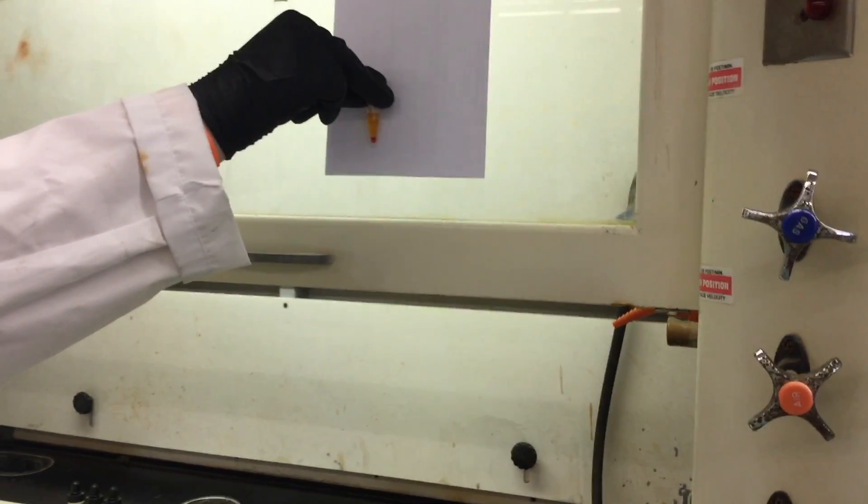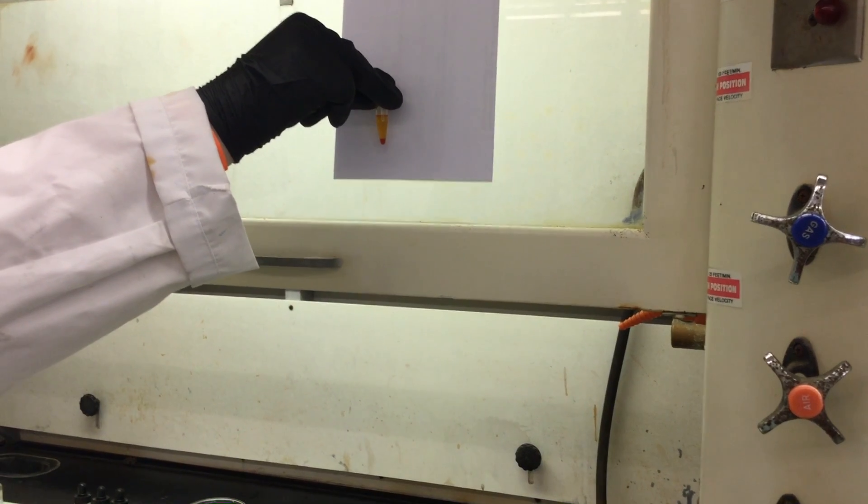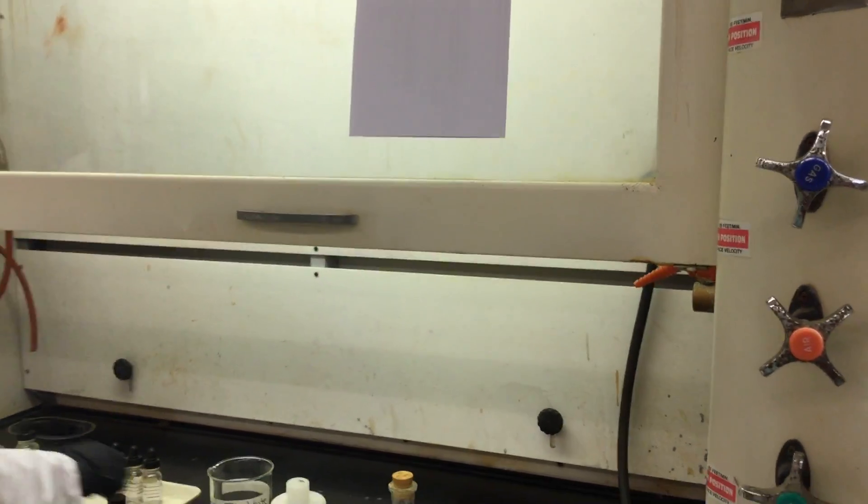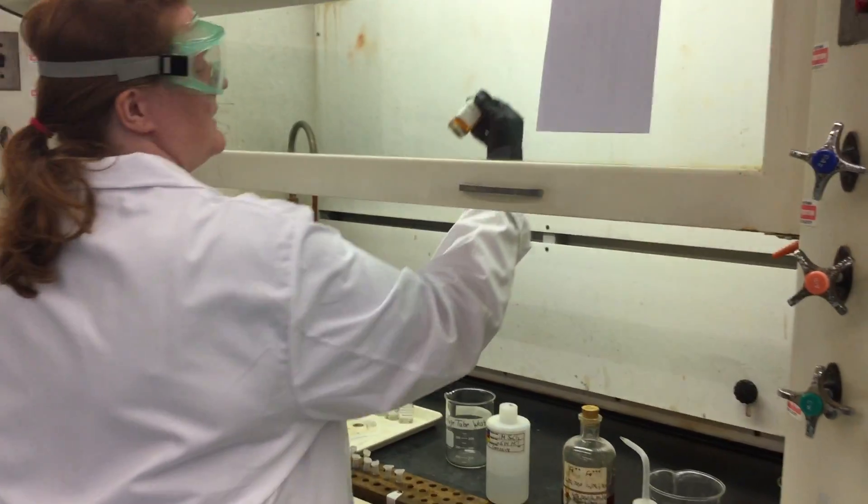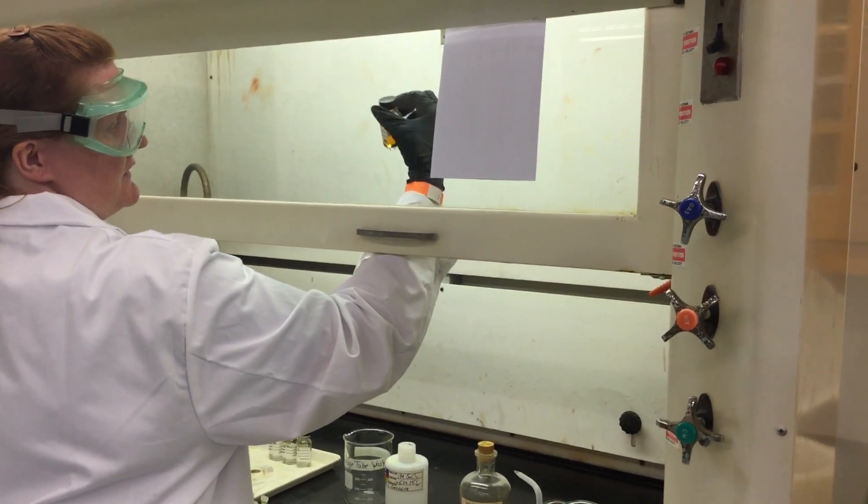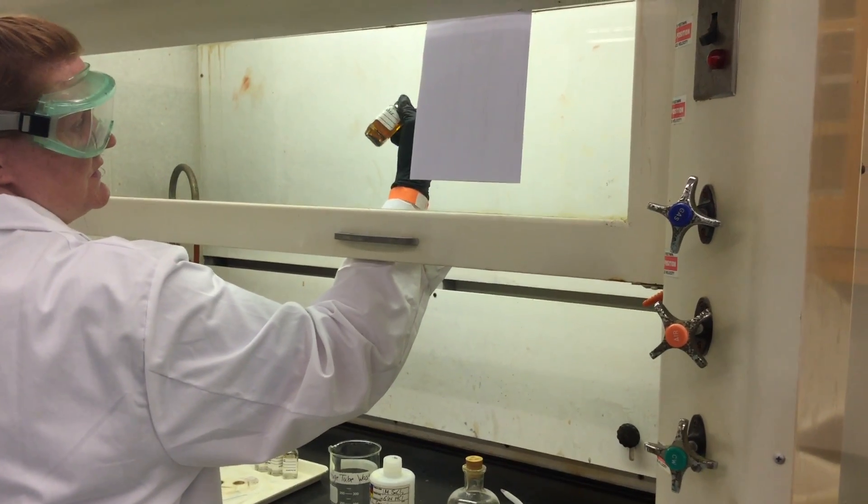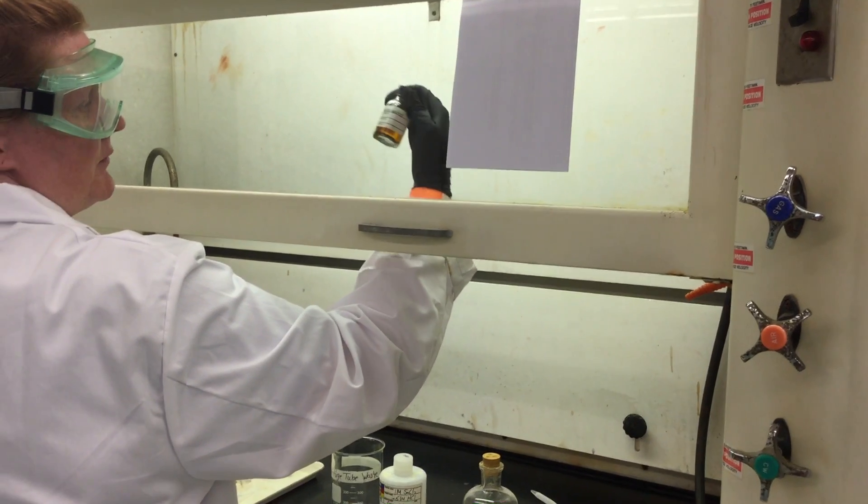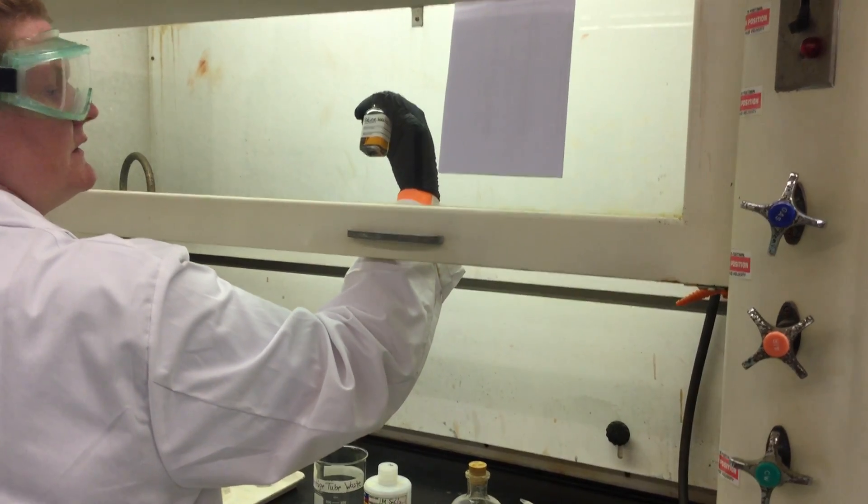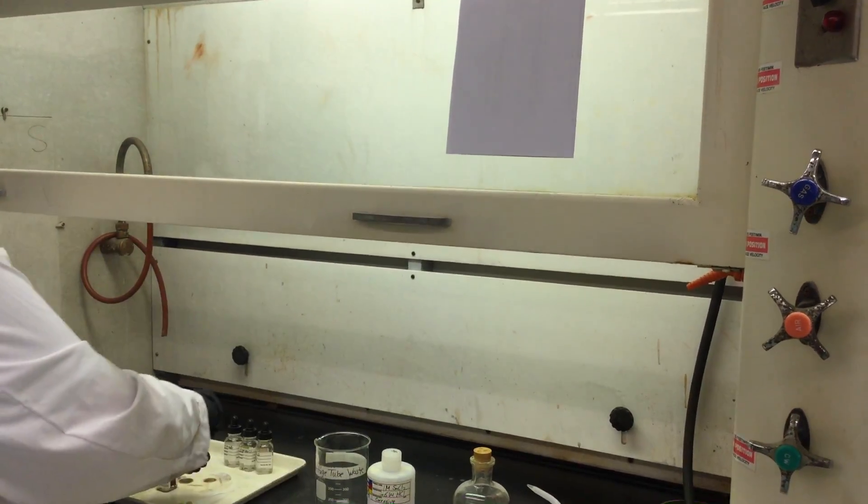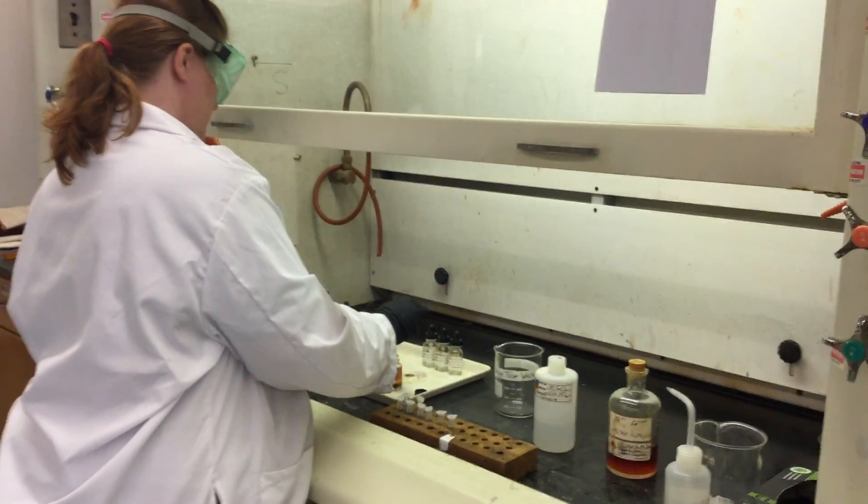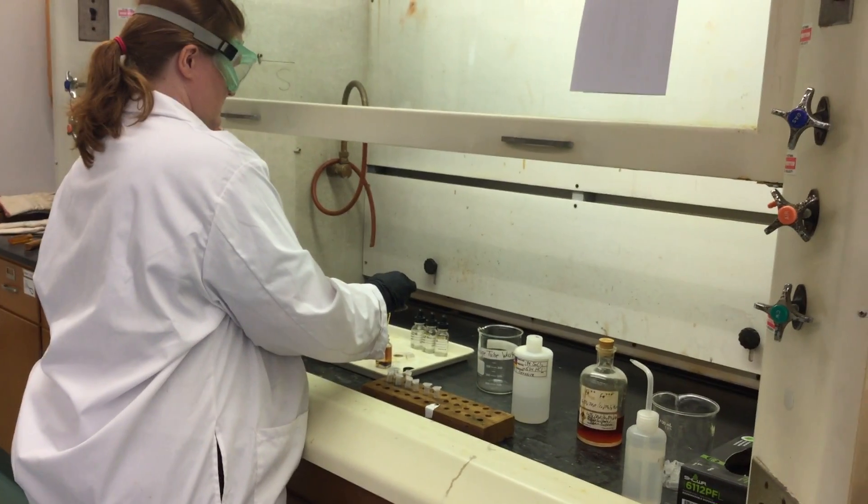Finally, we have iodine. Iodine is a solid at room temperature, so you can kind of see in the bottom of our bottle we have a saturated iodine solution, and it's actually just kind of pretty gray-purple sparkly solid—it's pretty neat.